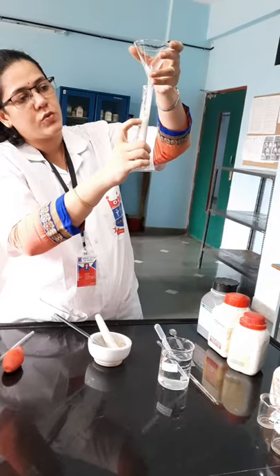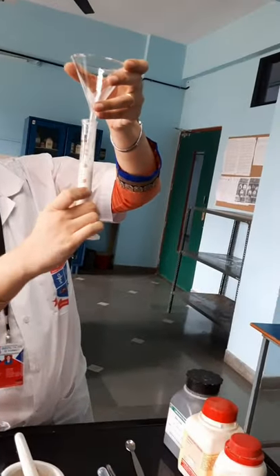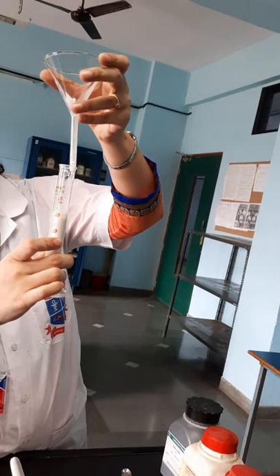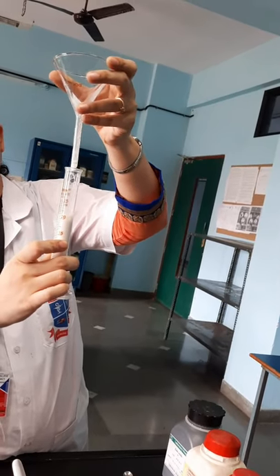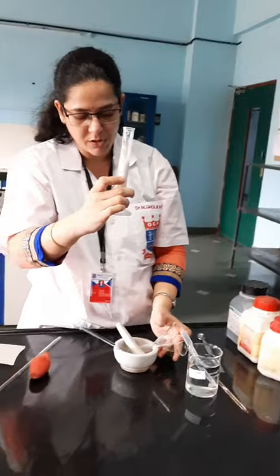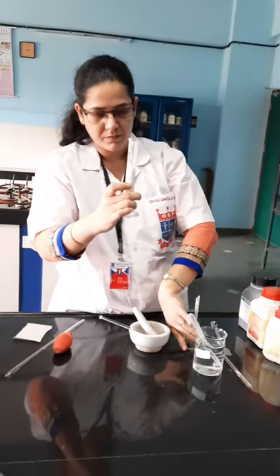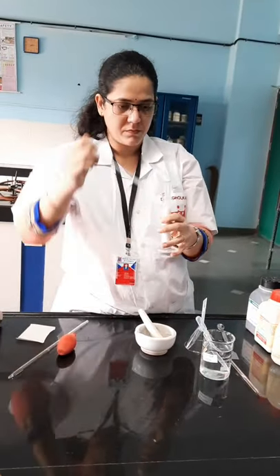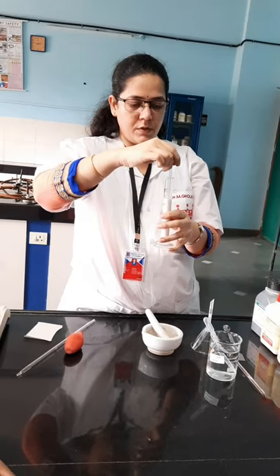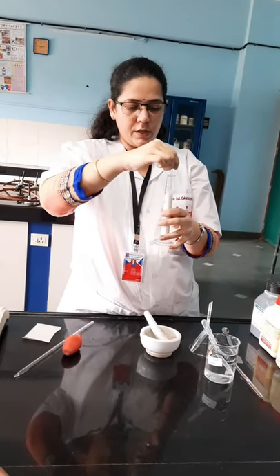There is froth on the surface, so you might feel the level is going up, but you have to observe the meniscus. This is now exactly 20 ml. Stir the suspension properly — you can use a glass rod for that — and ensure that it is evenly mixed.